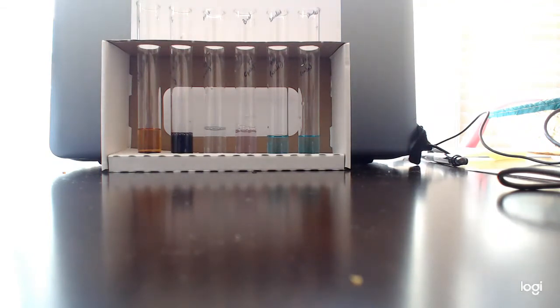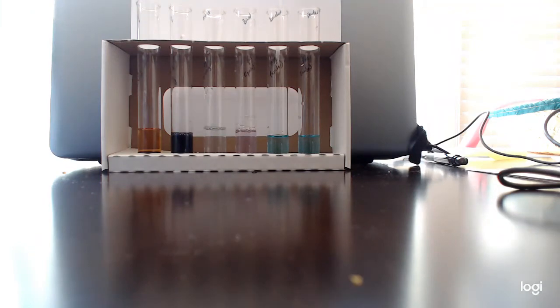So now that we have added that Benedict solution to our tubes, we're going to go ahead and add our negative and positive controls. You guys can guess what's going to be our negative control for sugars. What substance, which is the most important molecule that supports life, does not, ironically, have any sugar in it? You guessed it, it's water, so this is our water molecule. And we'll go ahead and put 20 drops of this in that.